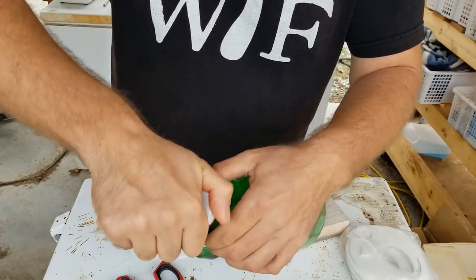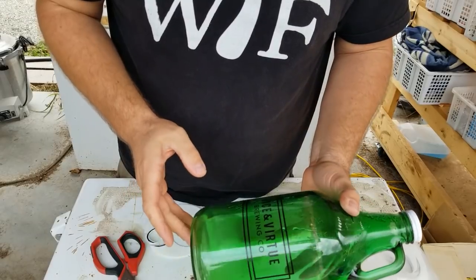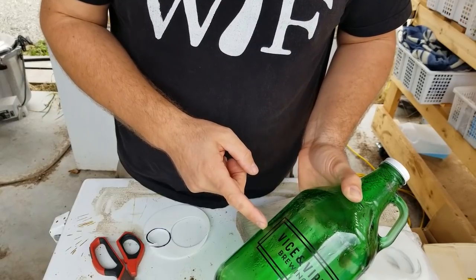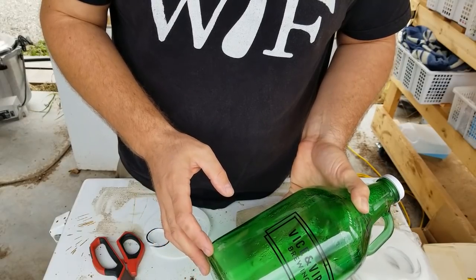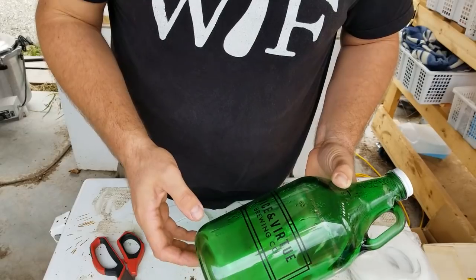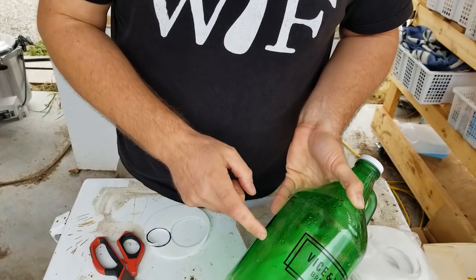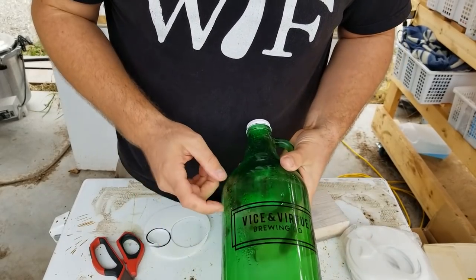This will be a really awesome addition to my bottles. We're going to mix the contents that go in these bottles and fill them about 60 to 70% full. When we fill up our pressure cooker and sterilize these, we want the water level to be at least half of the bottle. That's going to help regulate the cool-down so the bottles don't run the risk of breaking. Especially in colder weather, we want to bring our cookers into the lab to cool down, since they can cool down too quickly outside. Having water up to at least half of the bottle helps the bottles cool down a little bit slower and prolongs the life of your agar bottle.